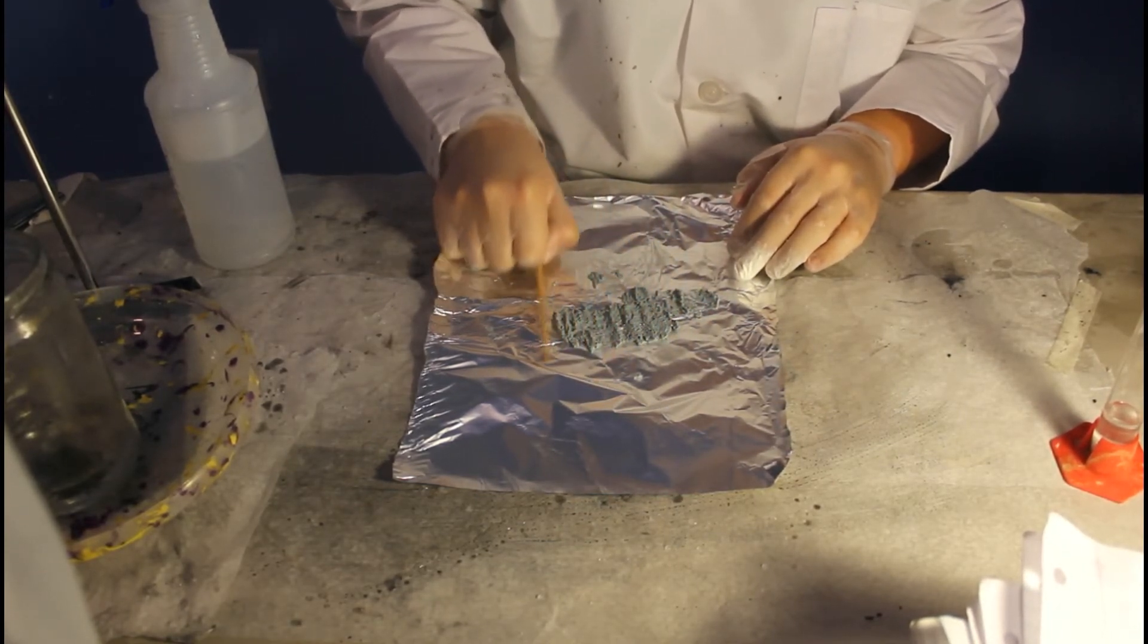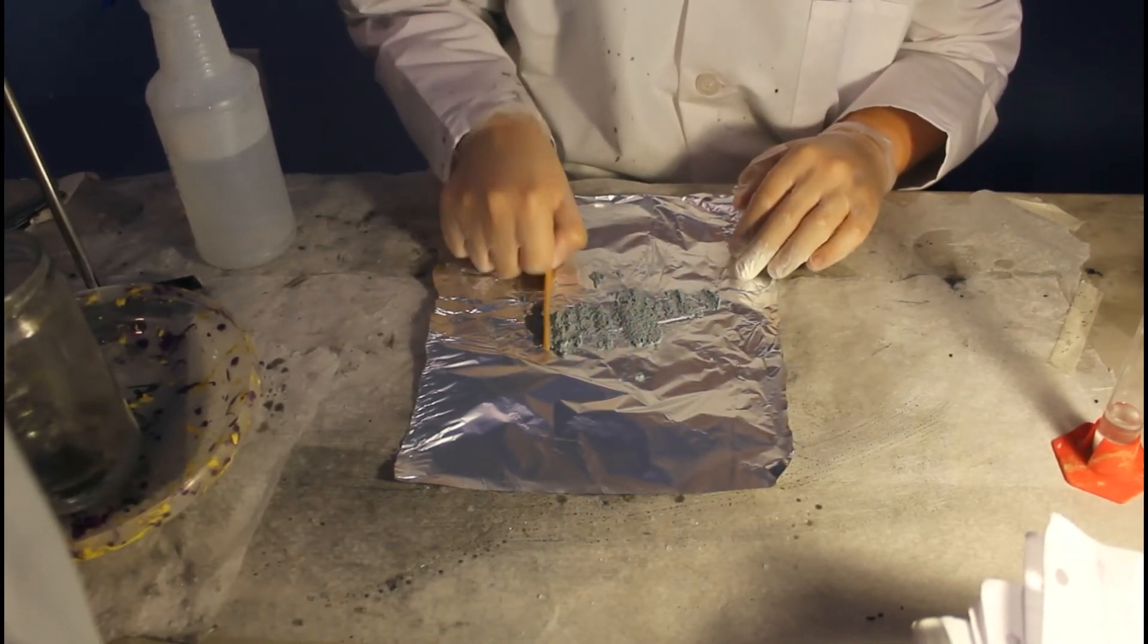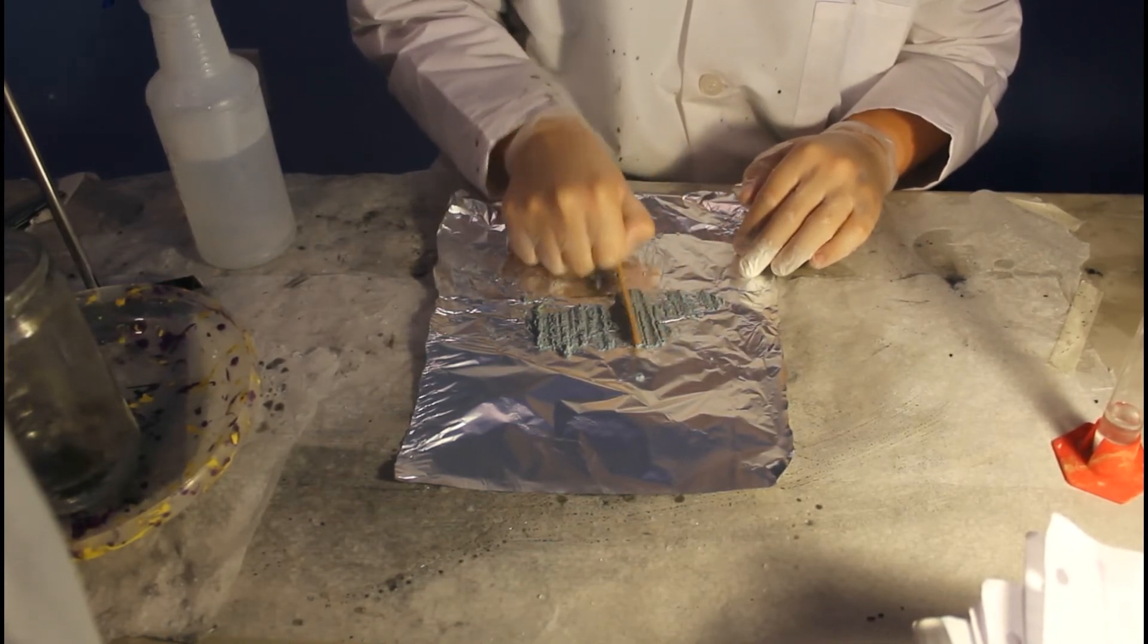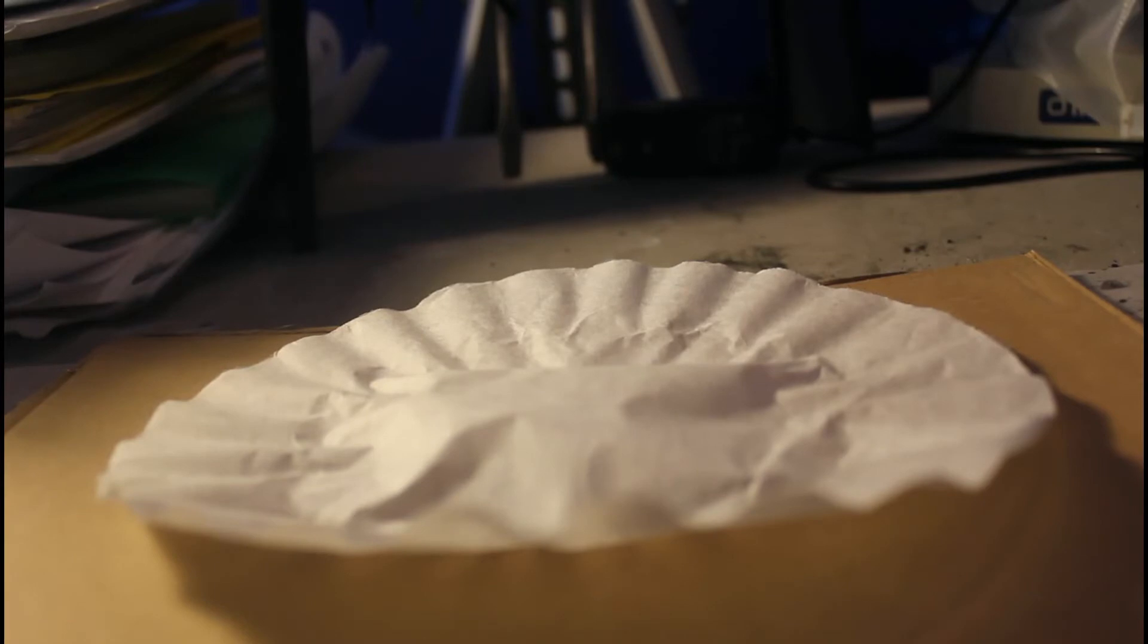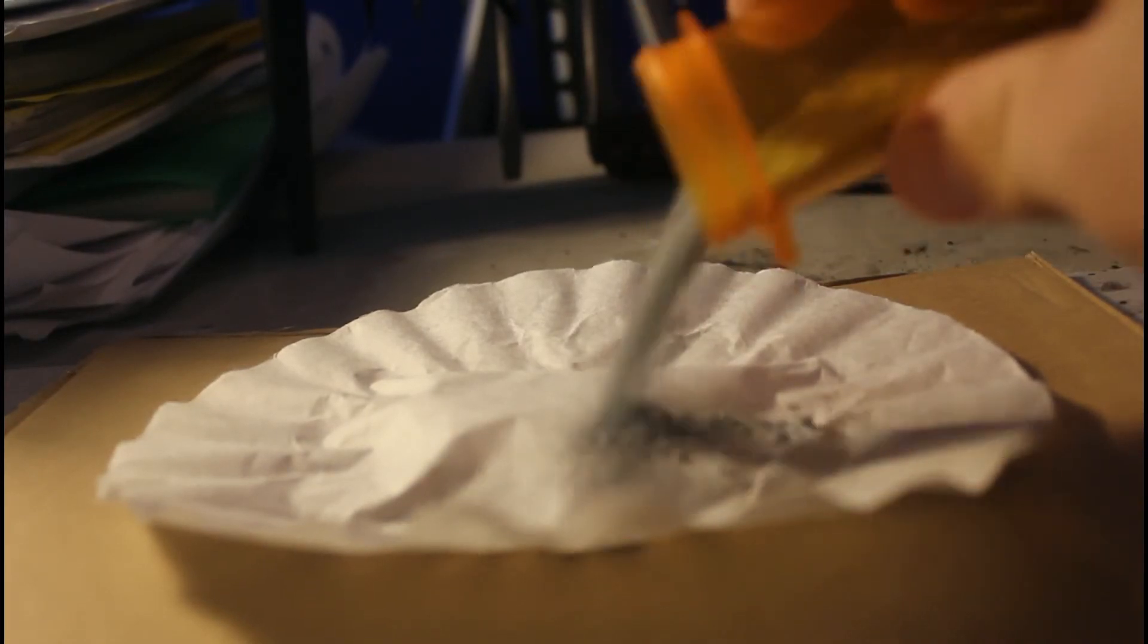After this, the zinc is set out to dry for 72 hours. Shown is the product left after 72 hours of air drying. It weighs approximately 21.2 grams. This will be used in a future video.